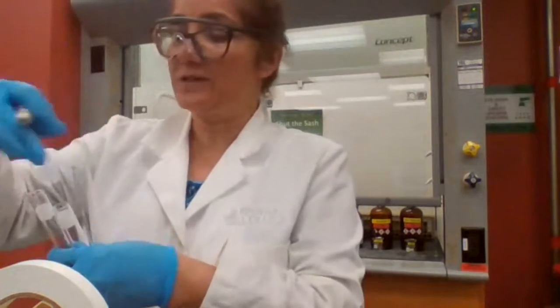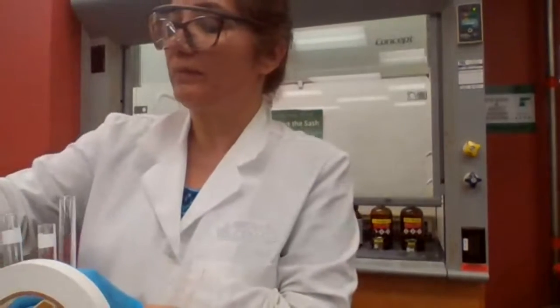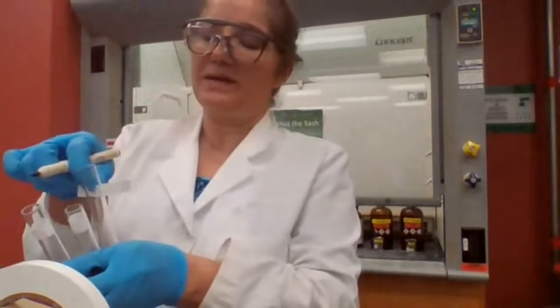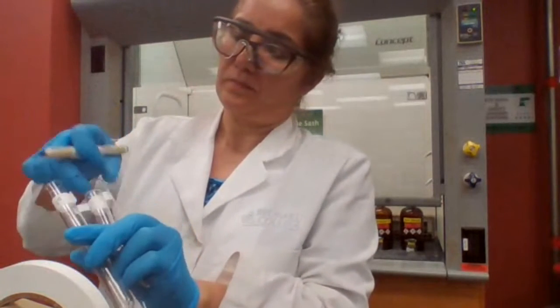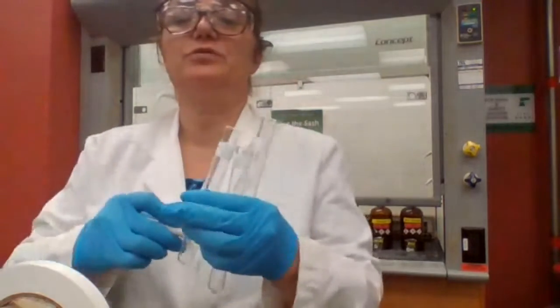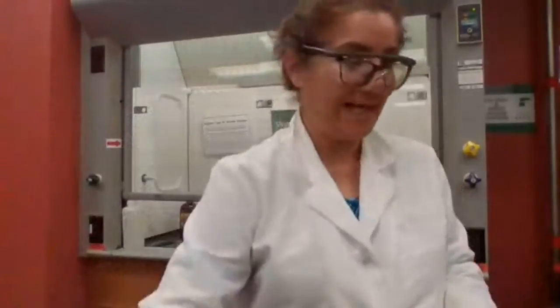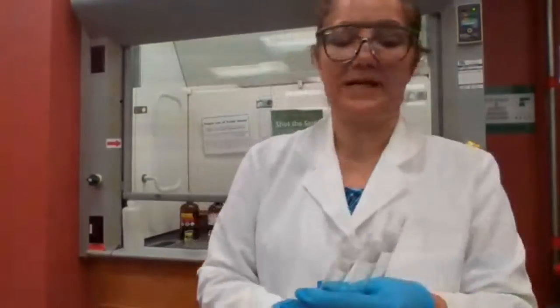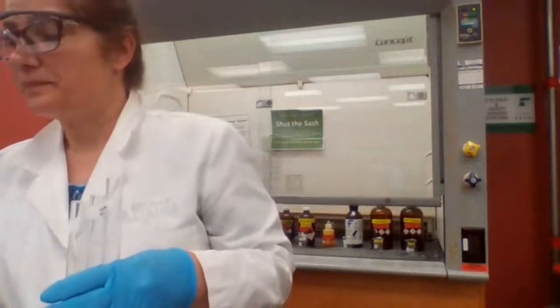I didn't say to screenshot, but if you did it, it's fine. That's good. You should record the evidence at least. What is the evidence? Okay, I'm waiting for you to tell me what to do. I only labeled my test tubes as primary, secondary, and tertiary. What should I do next?